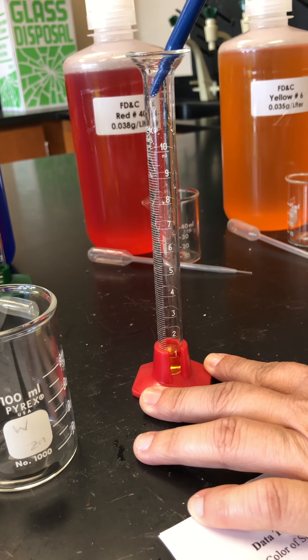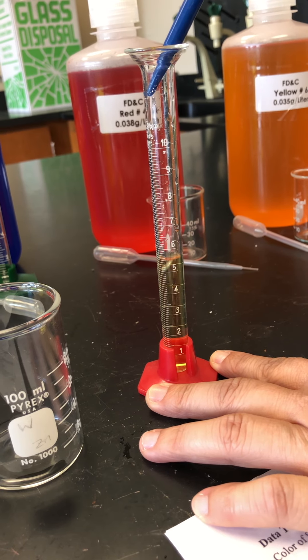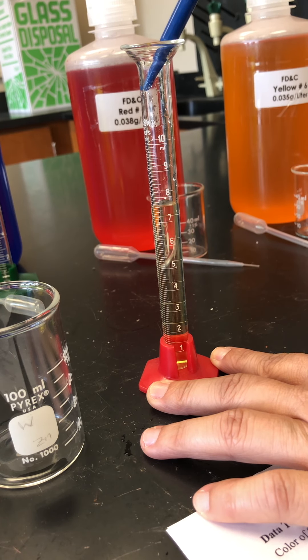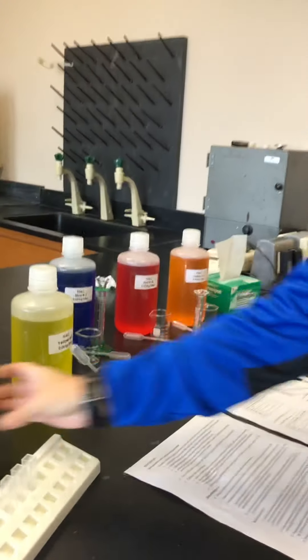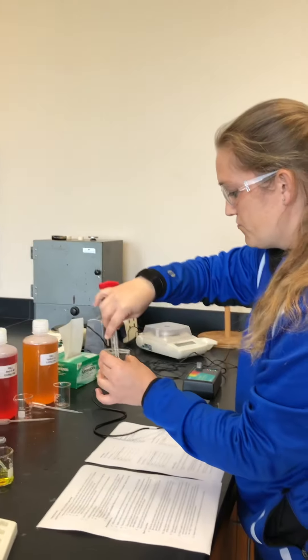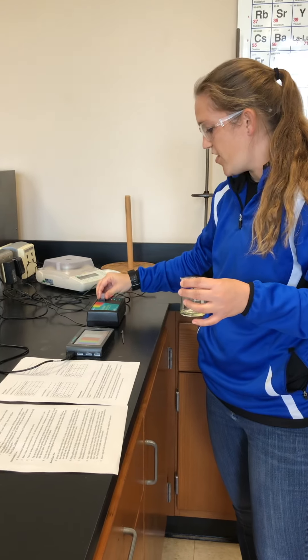Then we're going to go to 8 mL to get our 12.5 percent. You should notice that the color is getting less and less yellow. I think that's close. Put it into my beaker here, then use my cuvette and dump it out.